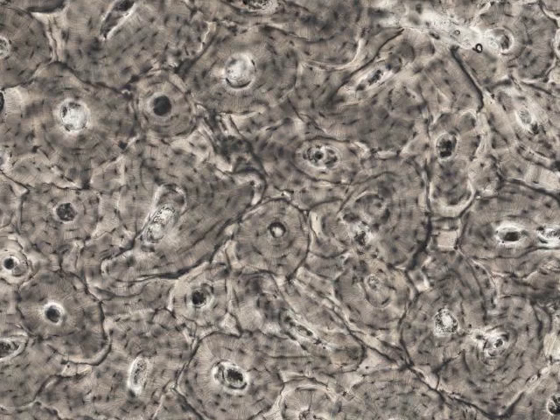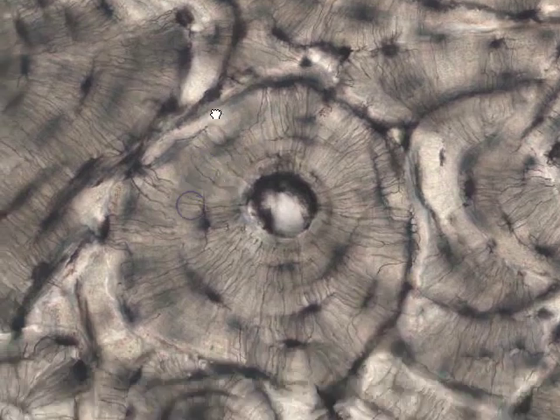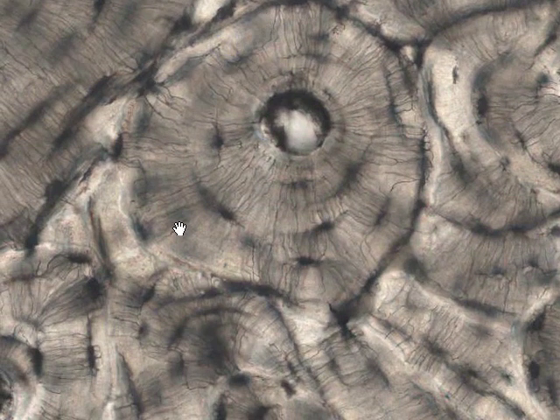And finally, if we move up into the highest end of magnification, so here, and if we pick just one osteon, let's take this small one in the center here. So here's the osteon itself, here's the Haversian canal, and surrounding Haversian canal in concentric layers are the osteocytes, the bone cells which have been trapped in their bony matrix. And you'll know from the lecture notes that one of the key features of osteocytes is that although they're trapped inside a bony matrix, they're not isolated, but in fact remain in communication with one another.